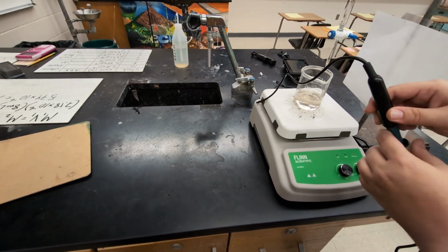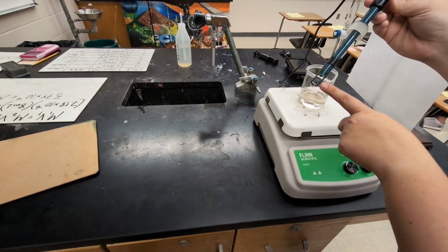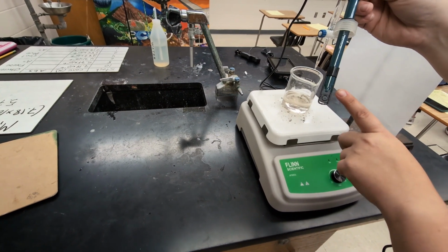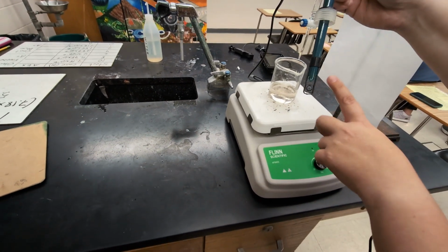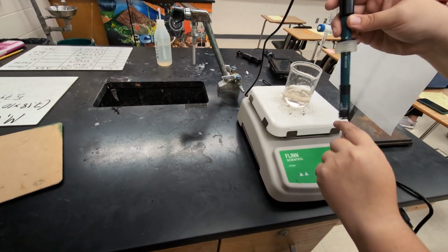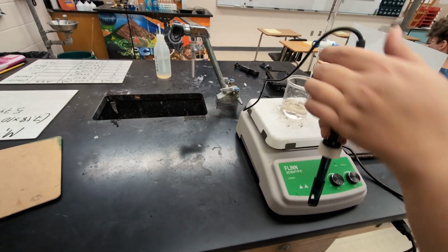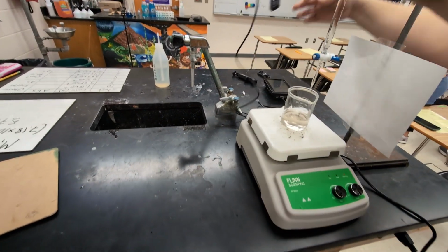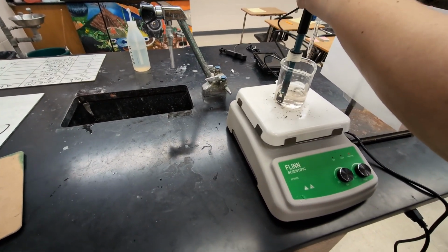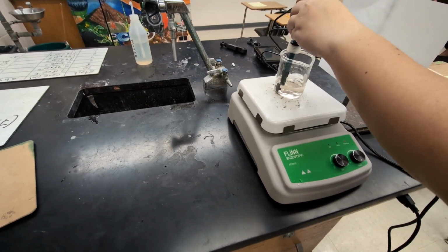And then you can use just a normal stir bar, or if possible, there is a little stir attachment for the pH sensors, which is really nice because it helps to protect your pH meter. The only problem with this is that you have to use more of the analyte because it has to completely cover the bottom of the pH probe. So then we want to set this up in the solution like this.